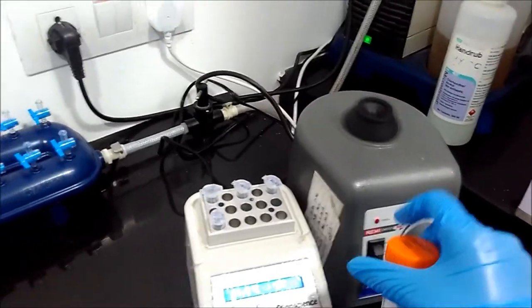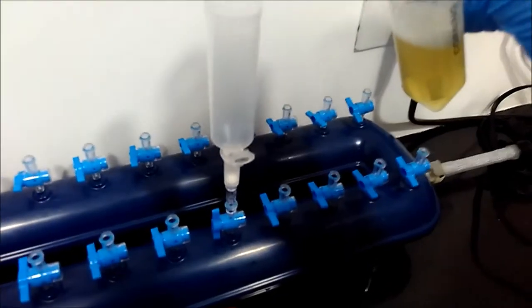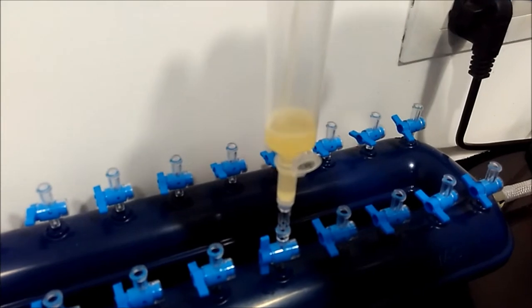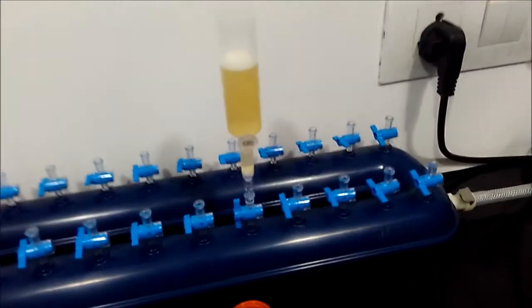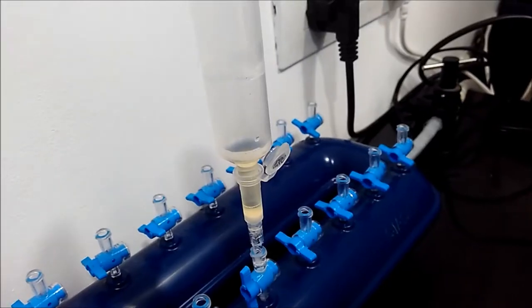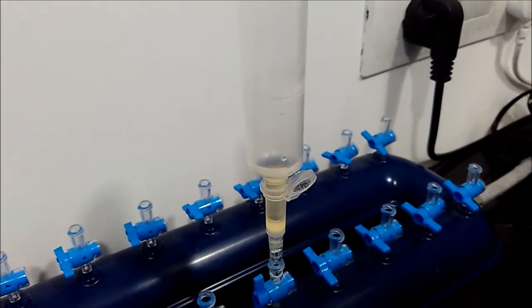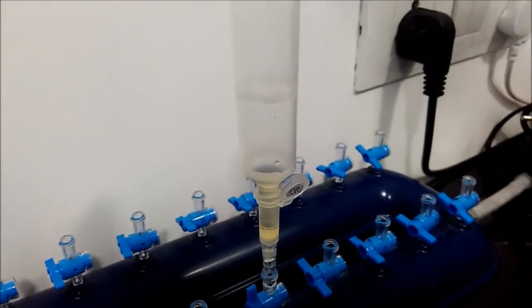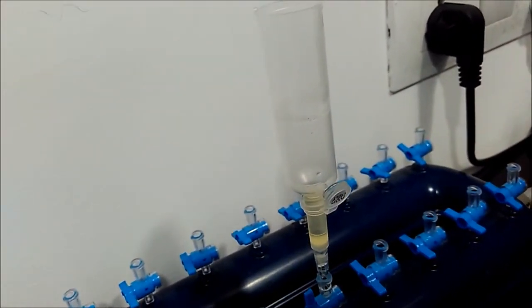After 10 minutes, we have prepared our vacuum system — the blue one — with a column on top and an extender to accommodate all the lysate. We put all the lysate into the column via the extender and start the vacuum system. This is basically an alternative to centrifugation: the vacuum passes all the plasma through a silica membrane, draining out unwanted material while nucleic acid binds to the silica membrane.